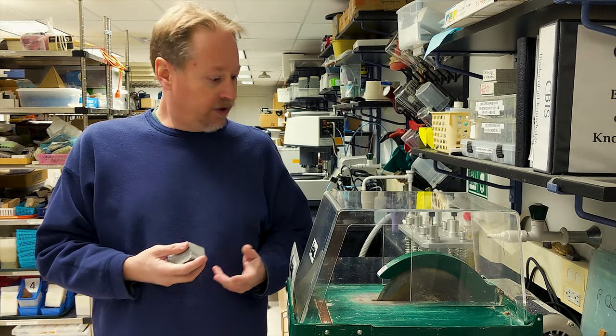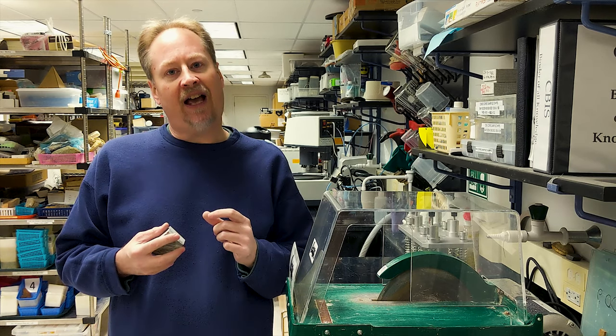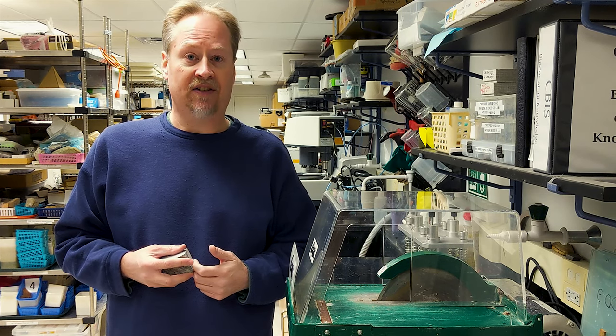The first piece of equipment to introduce you to is the rock saw, which of course is used to trim our rock samples down into suitable sized chips that can be polished and mounted onto a glass slide.